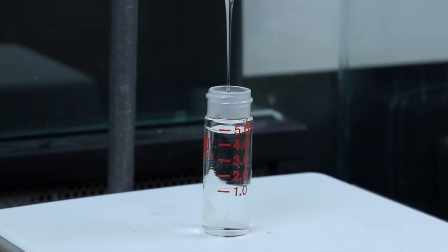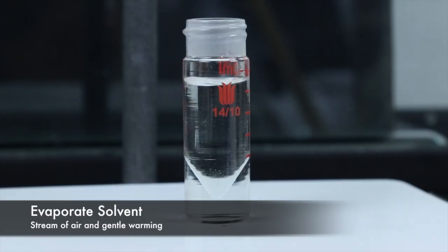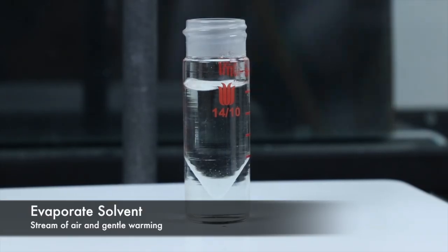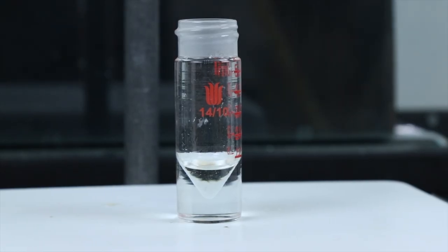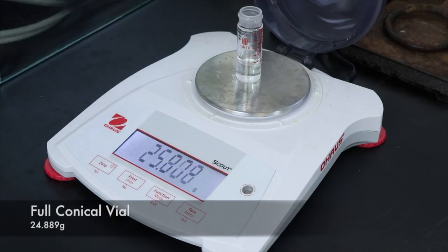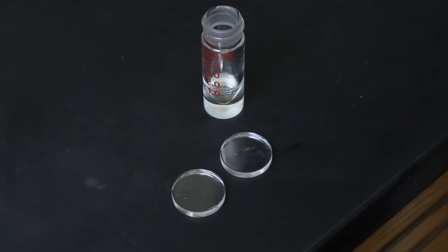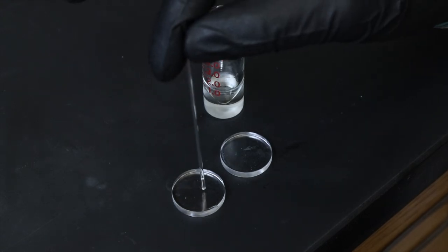Once that has been gathered, I can start evaporating the solvent using a stream of air and gentle warming again. Until the liquid doesn't seem to be going down any further, meaning that it's just product. Now I can weigh the full conical vial for the percent yield, and run a neat IR to see how pure the product ended up.